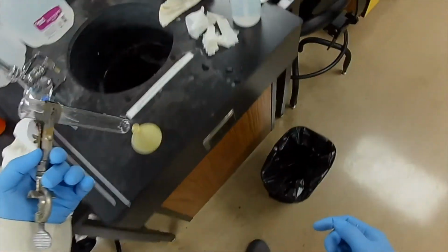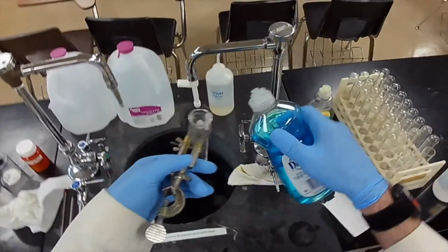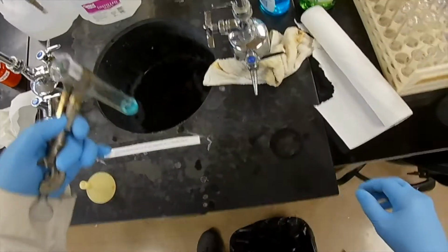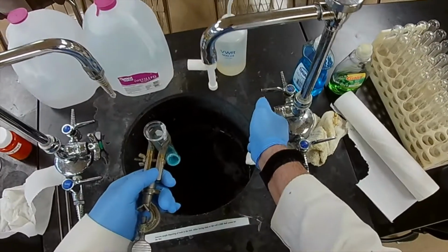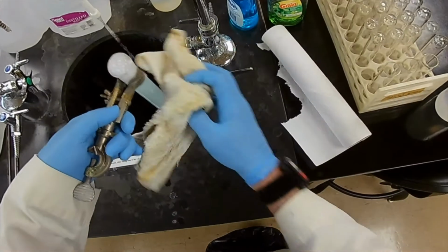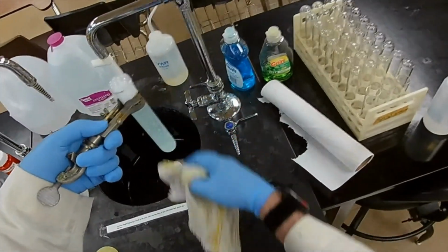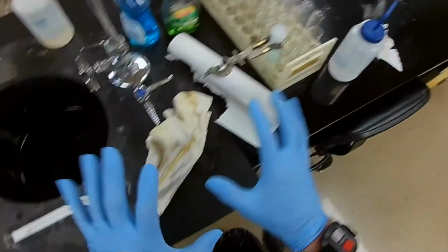What do we do about what's left in here? Well, there's just a film on the surface, which is easily attacked by something as efficient as the detergent Dawn. So we put a generous amount of Dawn in there, and then we try to get some water out of the faucet without drenching the whole bench. There we go. So we're going to let that sit. Now, it doesn't have to completely dissolve all the benzoic acid, lauric acid mixture. We just want it to release it from the glass. So there, it'll sit there. We'll just give it time to work.